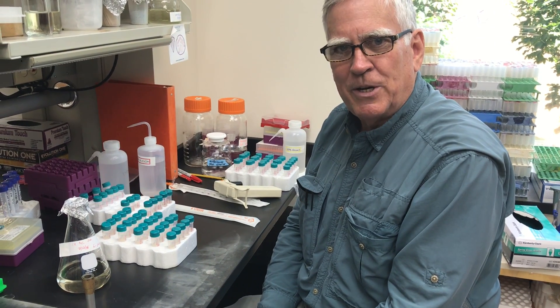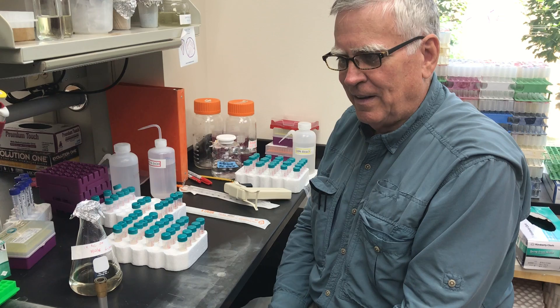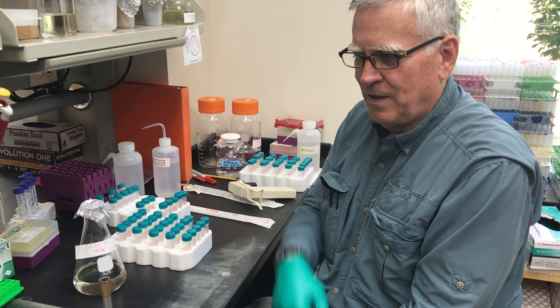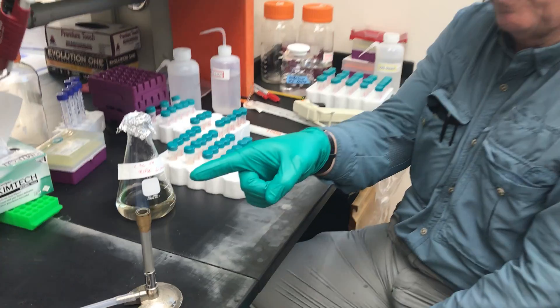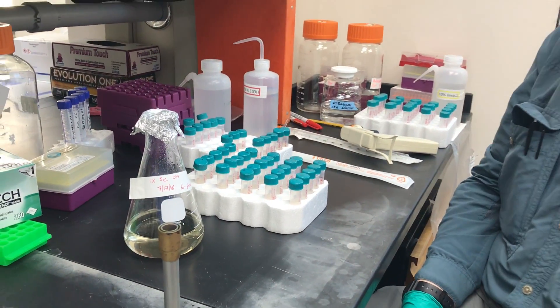This is going to be a demonstration on what I have been doing here. It's going to be real fun. You may feel like it's working on an assembly line, which it pretty much is. We've got a Bunsen burner going over here — if you can see the flame, that's to try to keep the other microbes off.